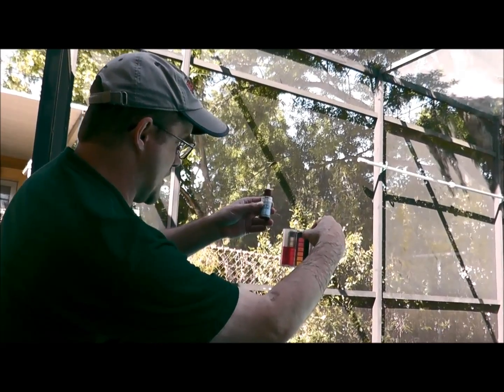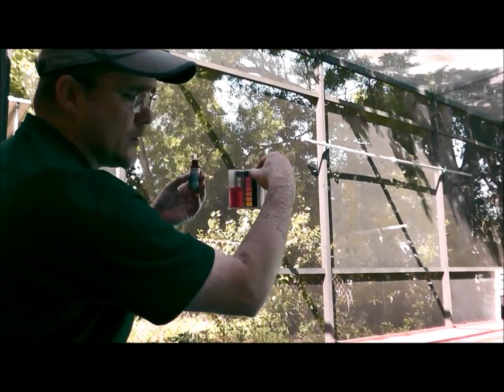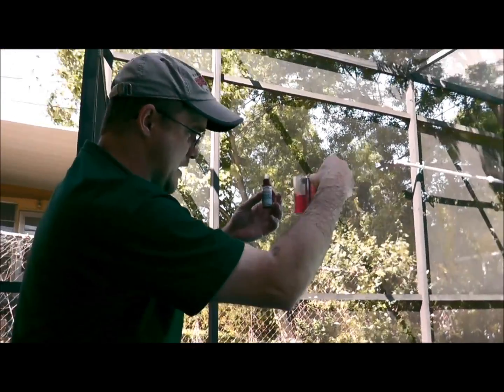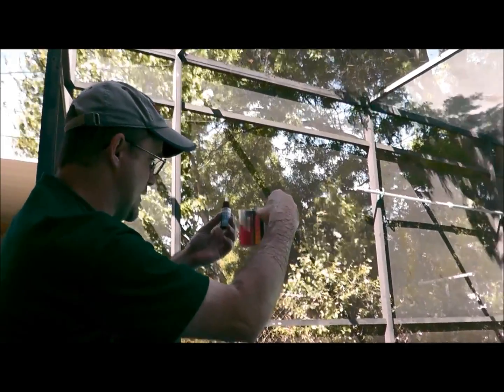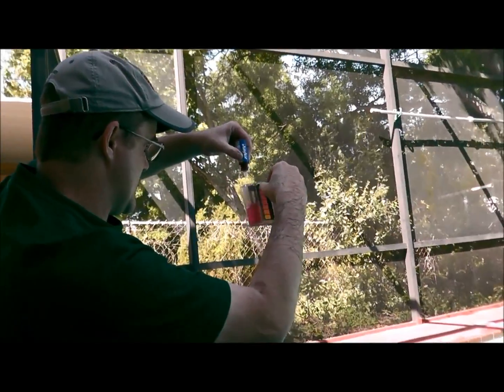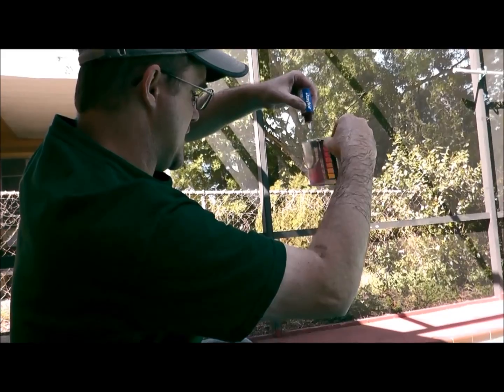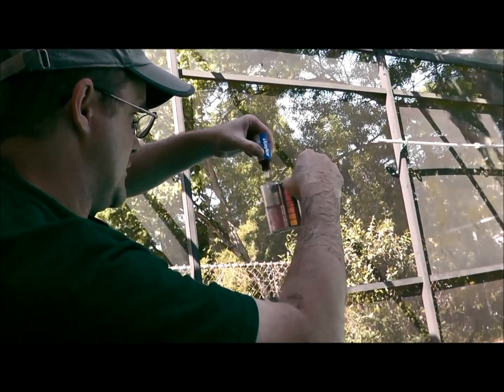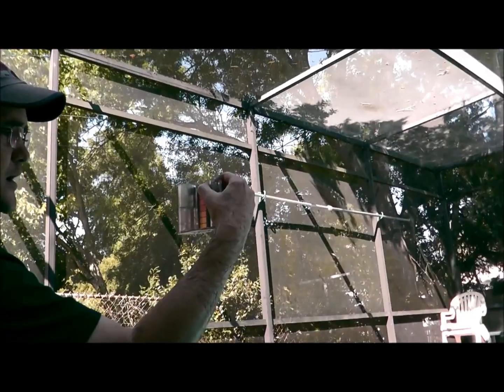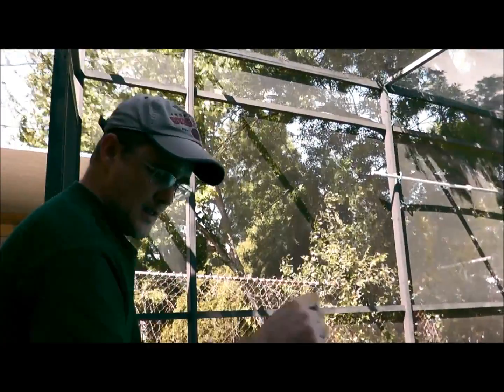I'm going to take the brown bottle R0871, flip it straight up and down, and start counting. There are several things happening at once: you're swirling, counting, and watching the solution go from pink to clear. One, two, three, four, five, six, seven, eight, nine — and one more — ten. And that went clear, so I put in ten drops.